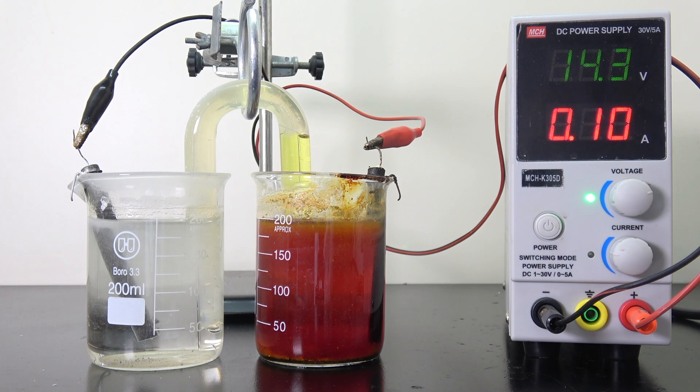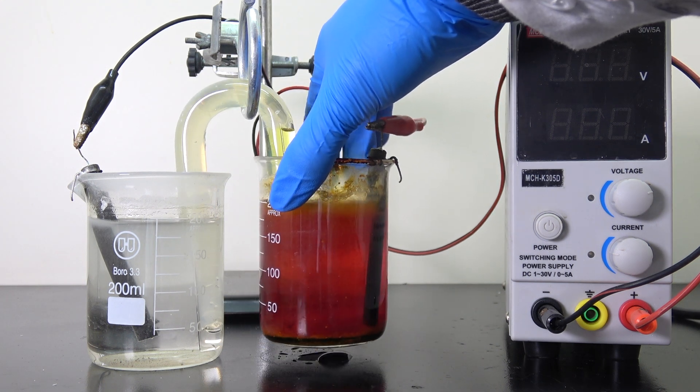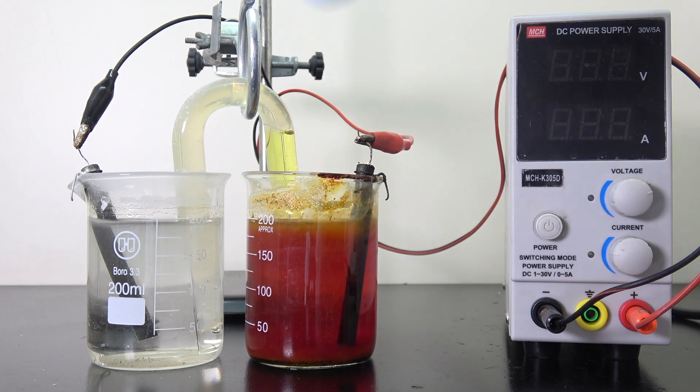Here we go, three days later. I could have let it run for a little longer, but I was running a tight schedule and I needed my fume hood for other projects, so I called it a day. It will have a negative impact on the yield, but oh well.